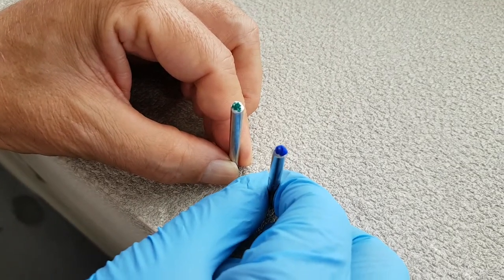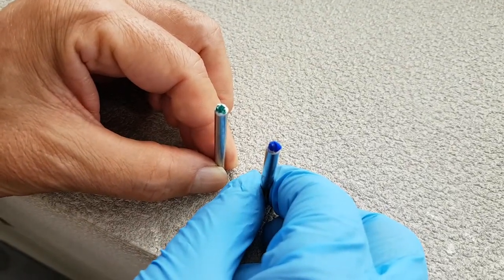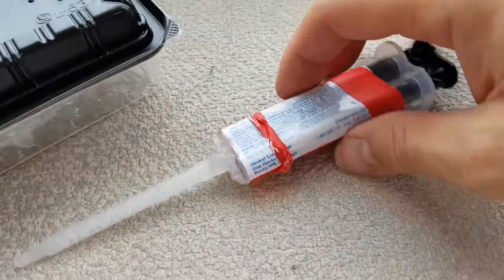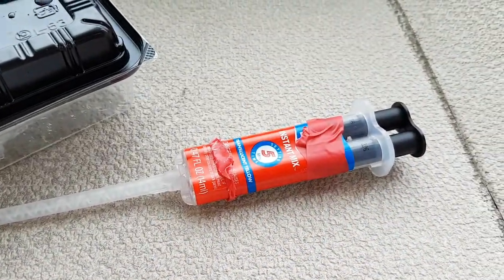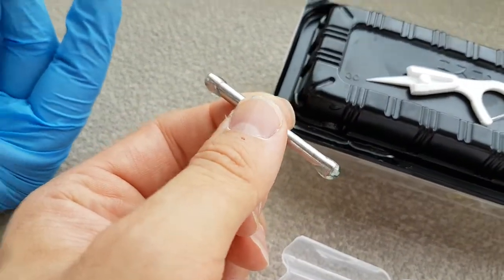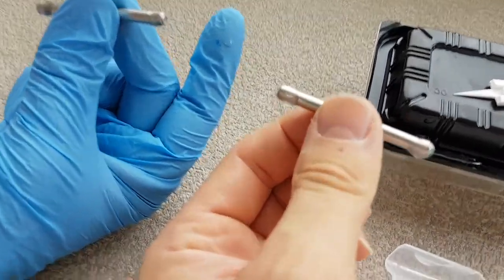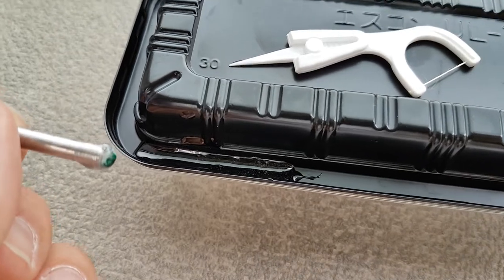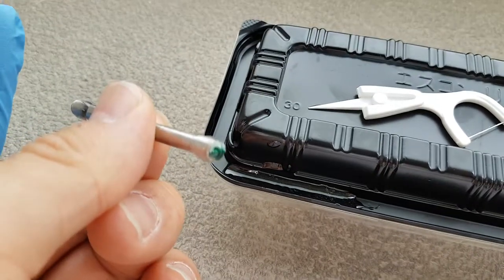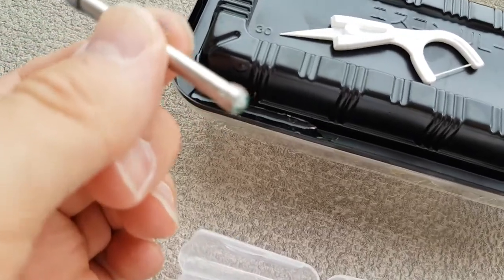We're just going to seal the two reaction vessels. The one on the right with the blue top is going to be the charcoal powder, and the one on the left is potassium carbonate. We're going to seal it with our two-part epoxy here. We have the two-part epoxy mixed up so you can put it on the ends — you can see the end with the tissue. Hopefully we'll be able to extract and then use the grub screw to remove.